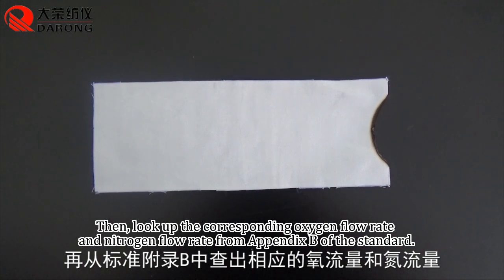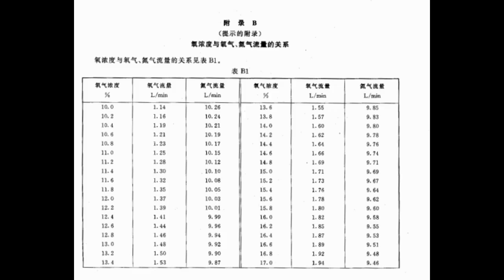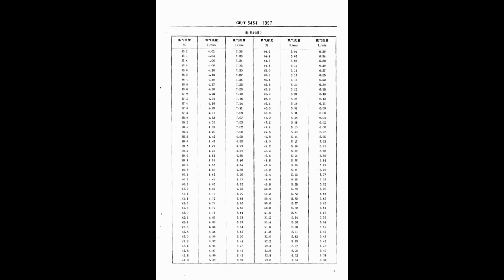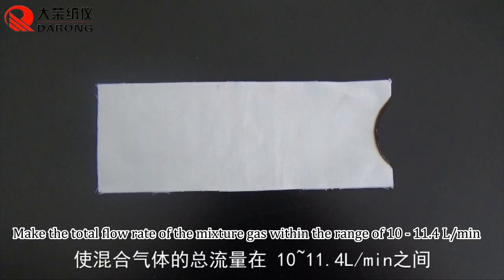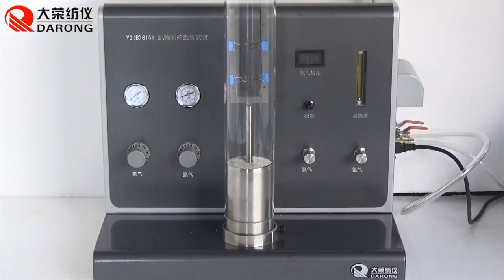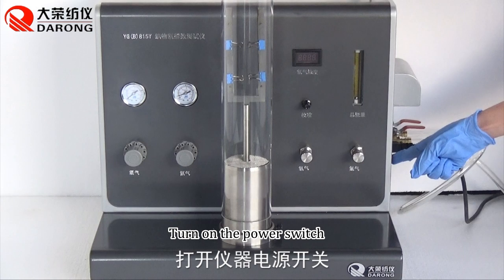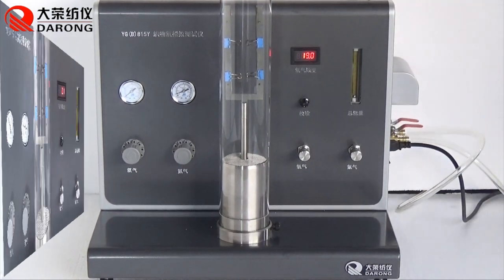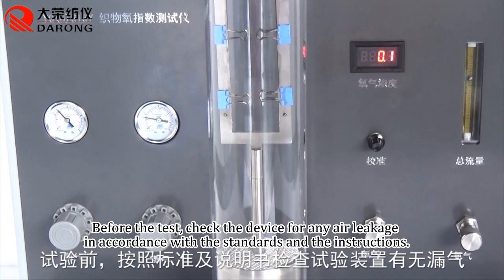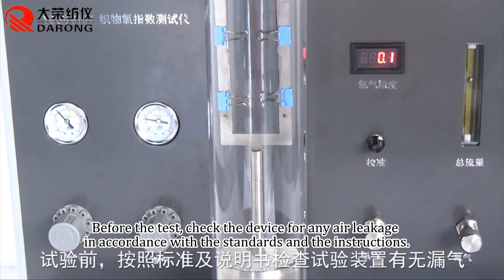Then, look up the corresponding oxygen flow rate and nitrogen flow rate from Appendix B of the standard. Make the total flow rate of the mixture gas within a range of 10 to 11.4 L/min. Turn on the power switch. Before the test, check the device for any air leakage, in accordance with the standards and the instructions.